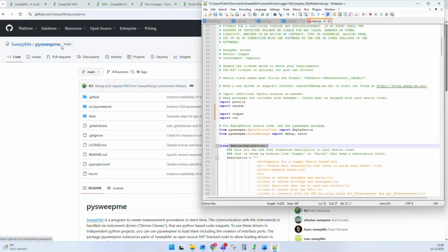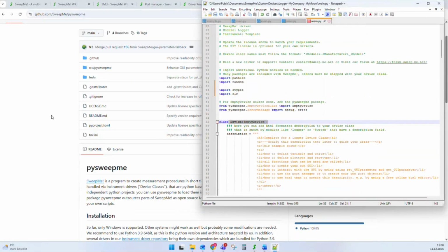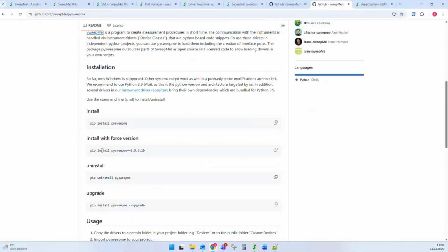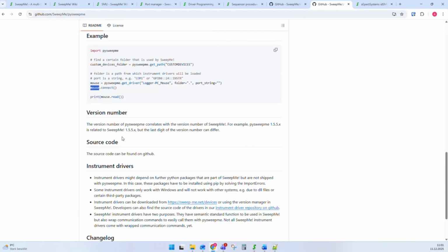And this means with pysweepme, you are able to run a Python driver in your own Python project without writing convenience functions on your own. They're already included in pysweepme. And pysweepme is a library that you can simply install with pip, like a normal Python library. And you find a simple example. There's one line of code that you need to load a driver and start running first commands from a driver. You have to add the name of the driver, the location of the folder where the driver is in, and the port string to open the driver. That's it. And then you have a ready-to-go object. You can directly call commands like connect or apply or all these semantic functions and so on.